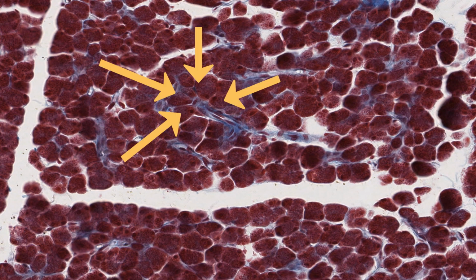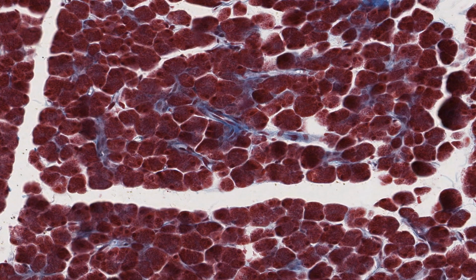The secretory acini have an interesting specialization, and that is that they include centroacinar cells. When a terminal intercalated duct meets an acinus, it protrudes into it, so that some duct cells lie right in the middle of the acinus. This is one reason that the acini are irregular in shape.